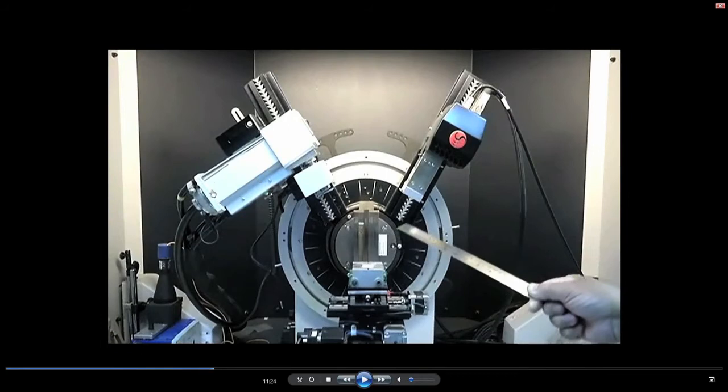I said that the X-ray source is here and the X-rays are going to come out through this exit window, and you remember the X-rays coming out of this window are a completely divergent beam, divergent in all directions. So, it needs to be controlled. One way to control this divergence is through slits, and we have typical slits which are popular, and which are kept inside, so that a collimated beam is made to fall onto this specimen.